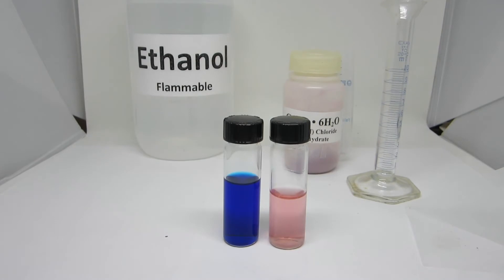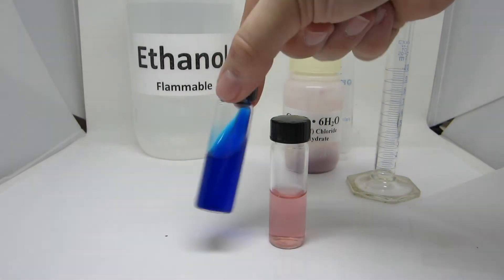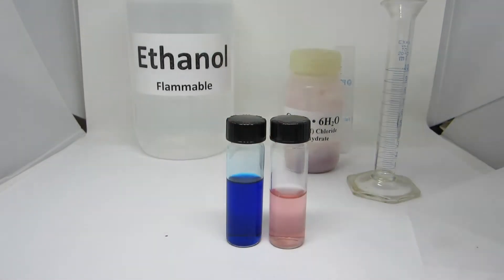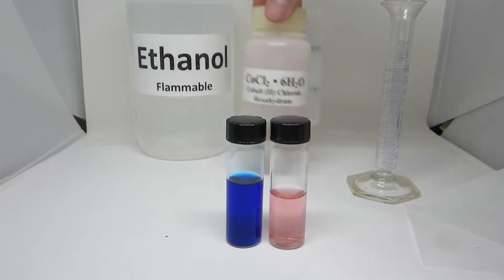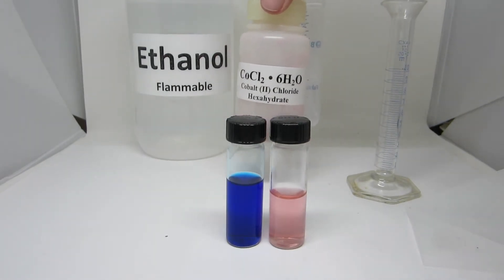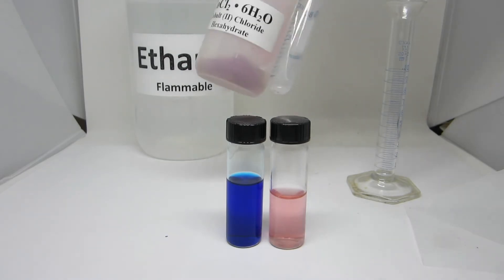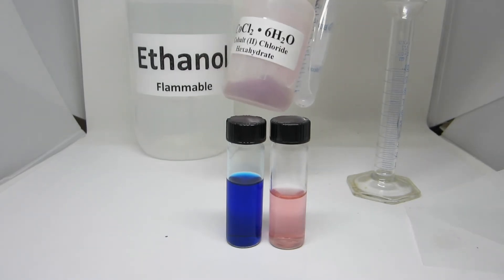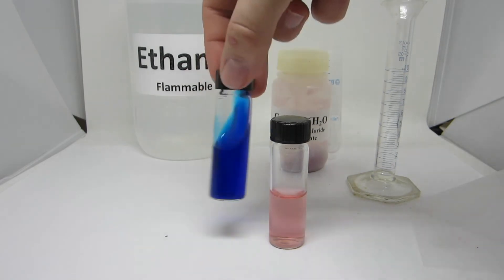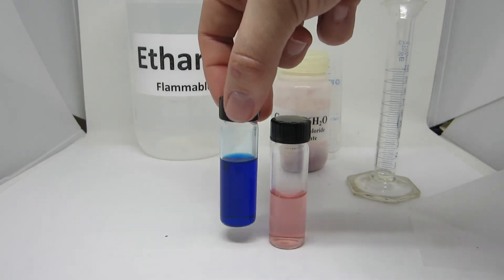There is still water present in the blue solution, however. The powder that was weighed is cobalt-chloride hexahydrate, and there are water molecules contained in the solid powder. Therefore, this solution is existing in equilibrium.